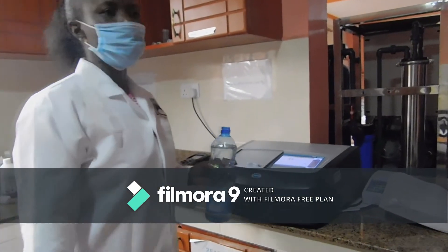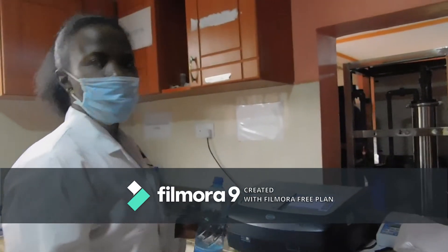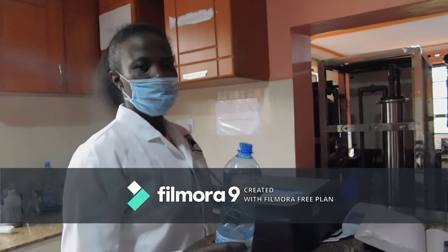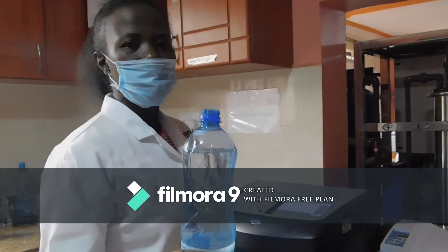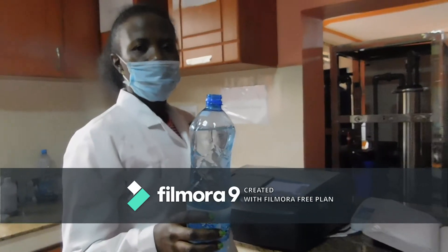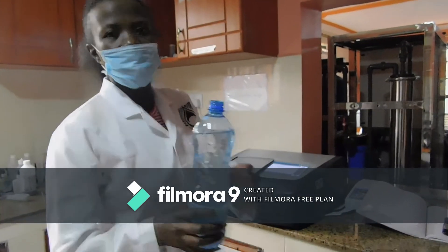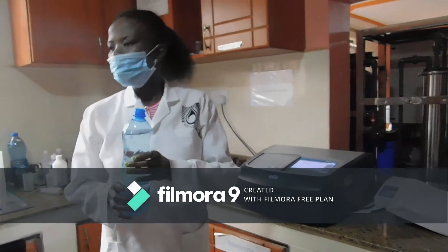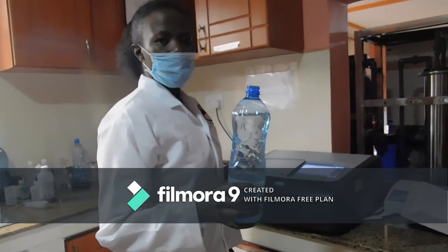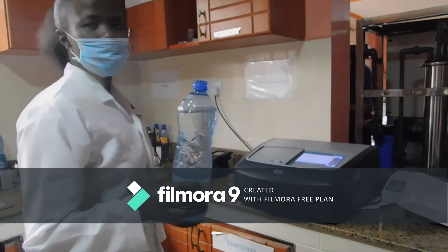For us to be able to carry out the analysis, we will require one liter of the sample. With the one liter, when we do the sampling, you are supposed to take a clean bottle, and when doing the sampling, you are supposed to flush the water for several minutes before sampling, and then you bring it to the laboratory.